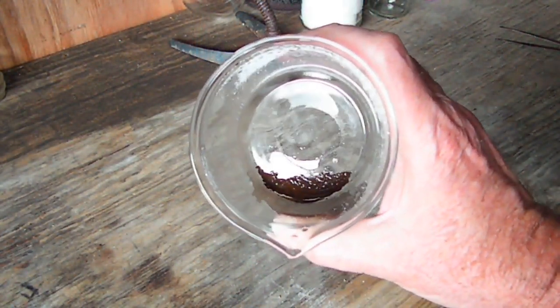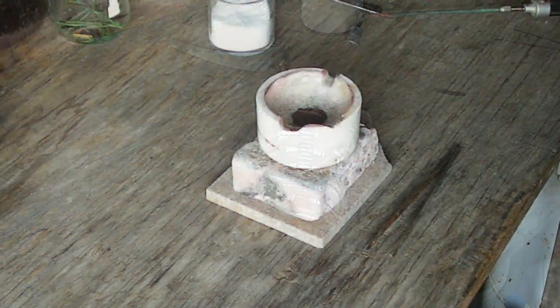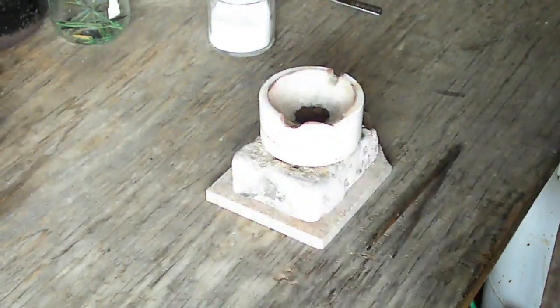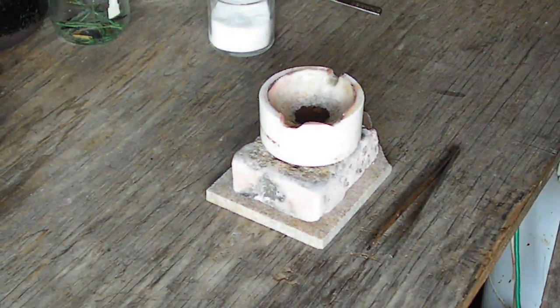Okay everybody, there is our gold. I'm heating up the rinse water right now and we're going to go ahead and get it rinsed a couple times. Then we're going to get it in a melting dish, melt it off, and see how much gold we got. After we see how much we got from this, we'll get that other button from the BGA chips, melt those two together, and I'll take my cut out of that. I'm going to time lapse the drying — we don't want any popping or banging or gold blowing out. I'll be back at you guys talking in just a few minutes.